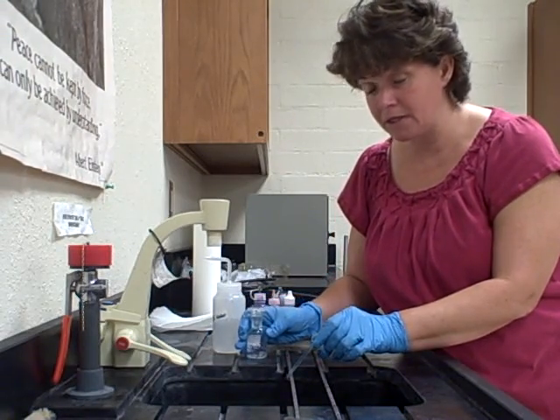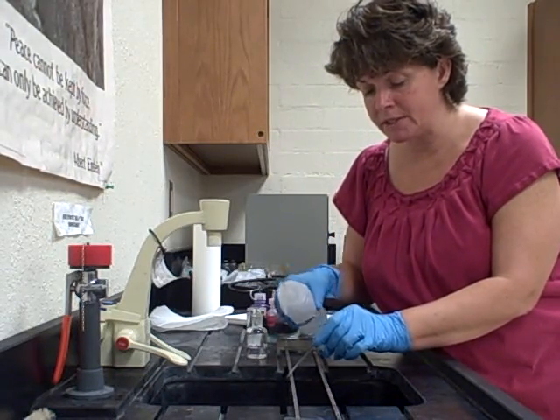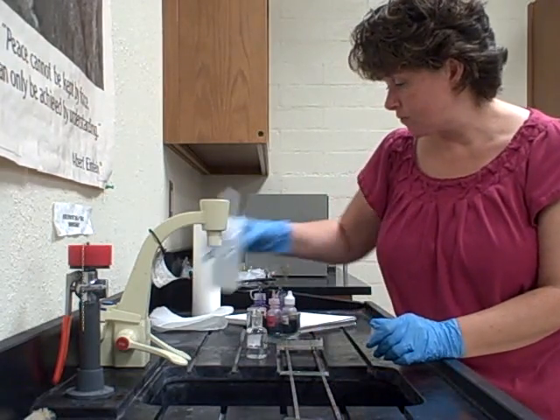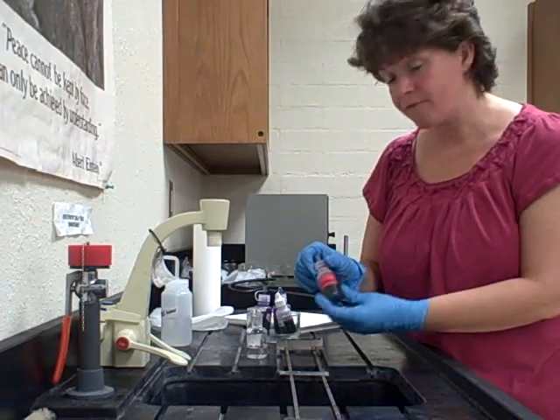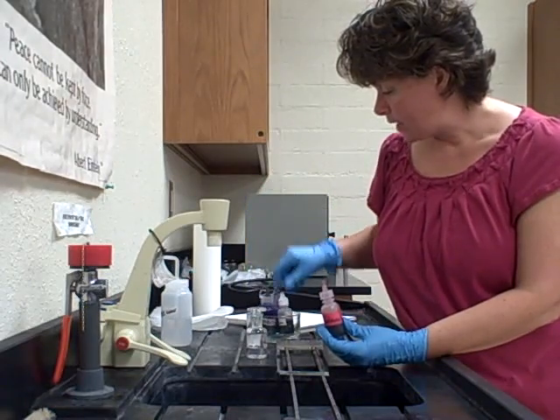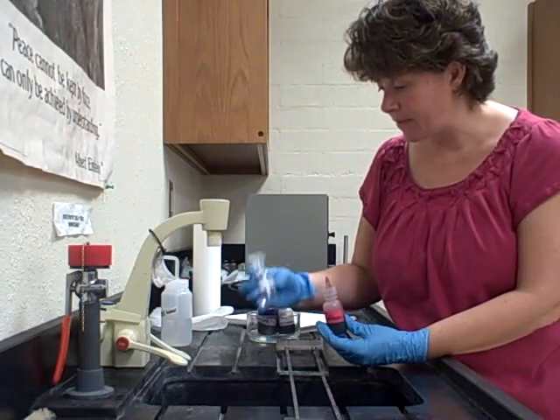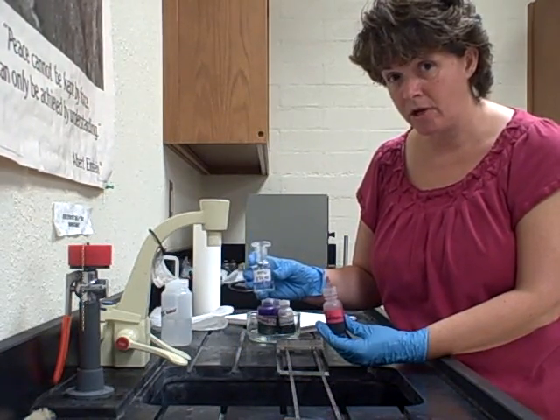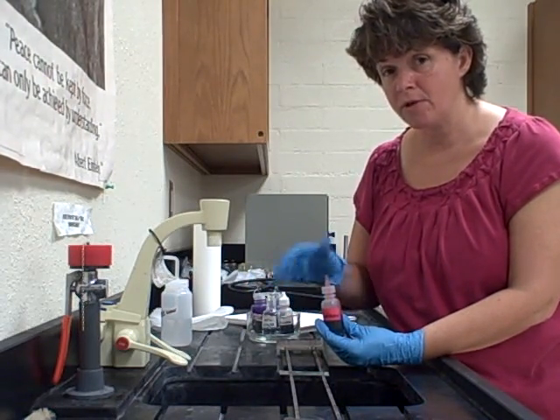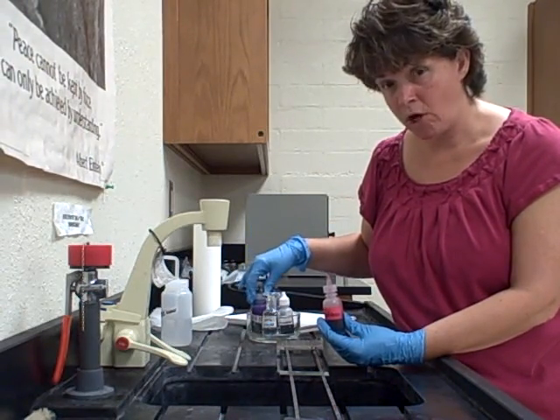Once decolorized, immediately rinse with water so no alcohol remains to continue decolorizing. After rinsing well with water, we're going to put the safranin on, which is the counter stain. To recap: crystal violet was the primary stain, gram's iodine was the mordant, ethyl alcohol or acetone alcohol was the decolorizer, and safranin is the counter stain.